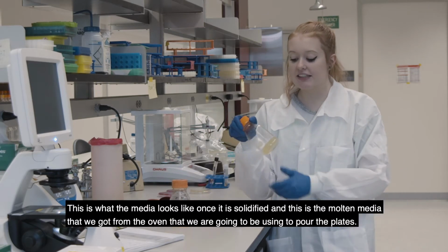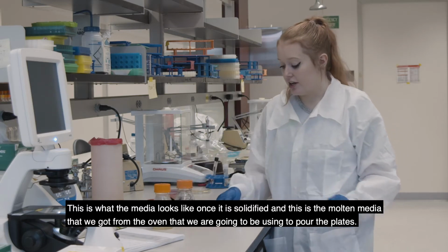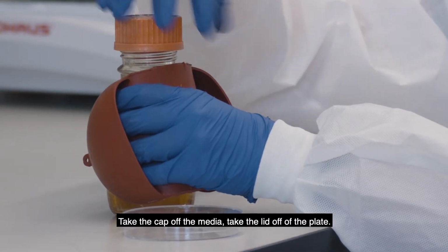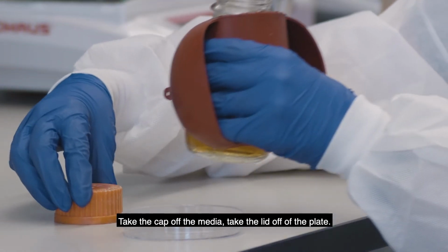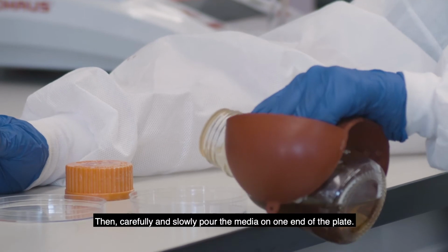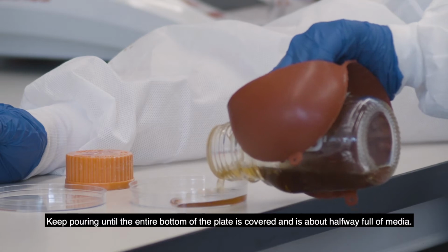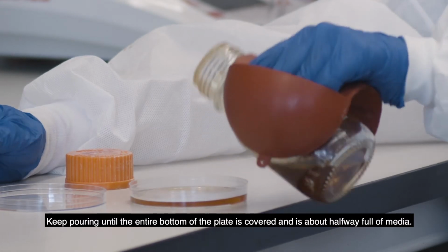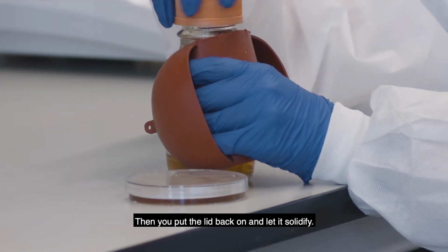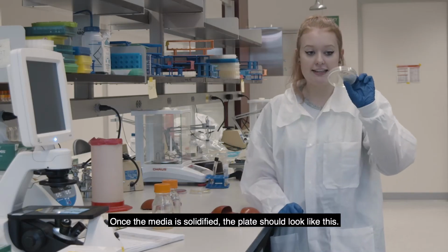So this is what the media looks like once it's solidified, and this is the molten media that you got from the oven that we're going to be using to pour the plates. So you can just take the cap off of the media and then take the lid off of the plate, and then you just want to carefully and slowly pour the media on one end of the plate, and then just keep pouring until the entire bottom of the plate is covered and it's about halfway full with media. Then you can just put the lid back on and let it solidify, and once the media is solidified in the plate, it should look like this.